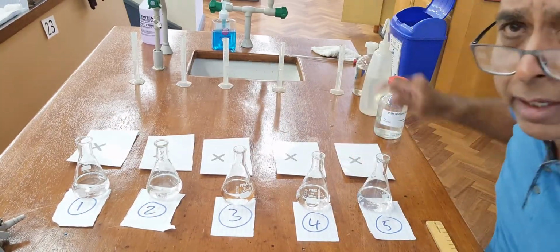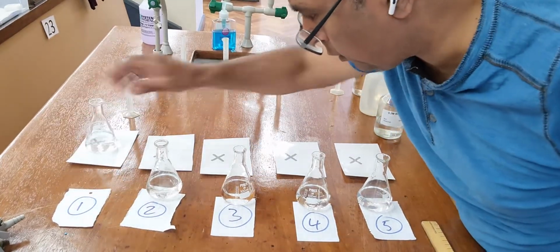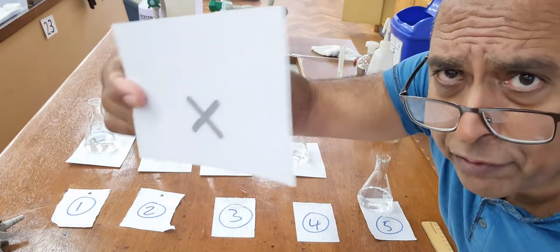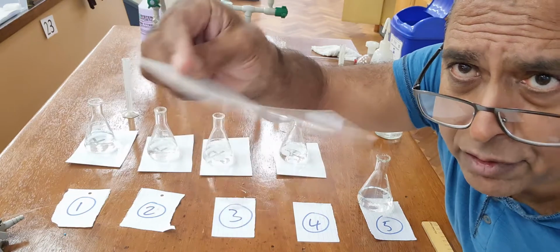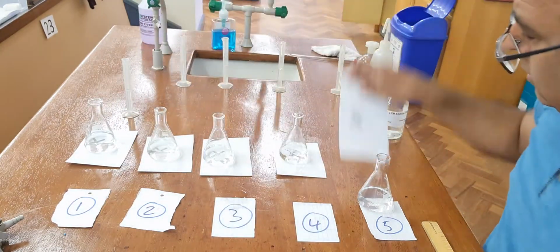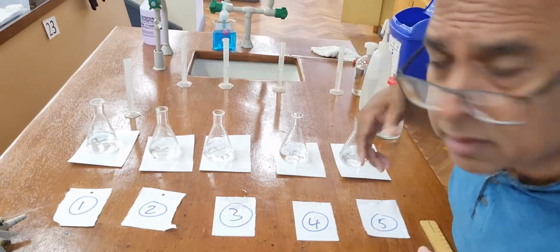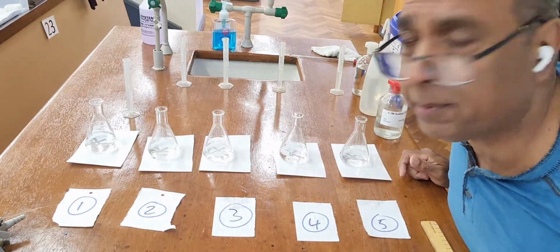Now we can start the reaction by putting these on the crosses. Show you these crosses. I've had the crosses photocopied so that they're all the same cross, and I've had them all laminated to stop water wetting them. So the same cross, laminated. It's important that the flasks are the same size because we want that height. We want the depth to be the same so that we can compare them.